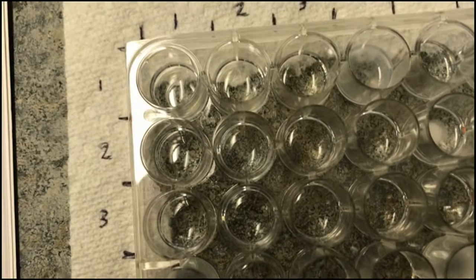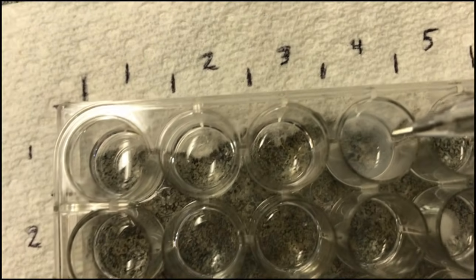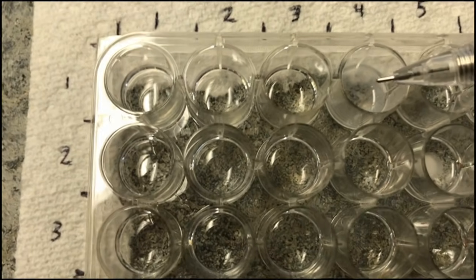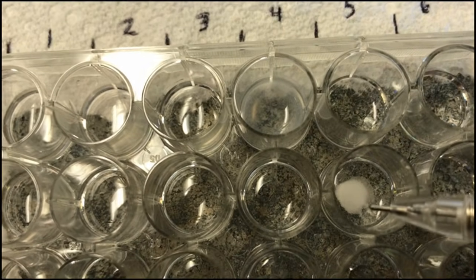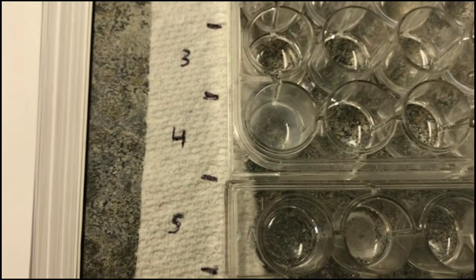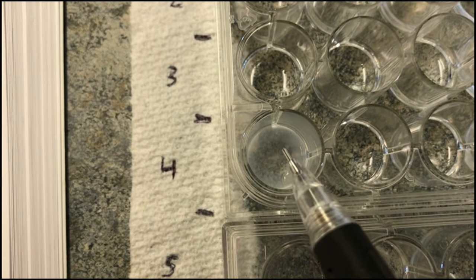It's hard to see some of these on the camera, which is why we showed you the observation side first. Here we have this pale white precipitate, not many distinct grains or particles. Then if we go into 2 and 5, we also have this white precipitate with some very distinct grains and particles. Row 3, we don't see anything. Row 4 and 1, we have this pale white, sort of milky precipitate.